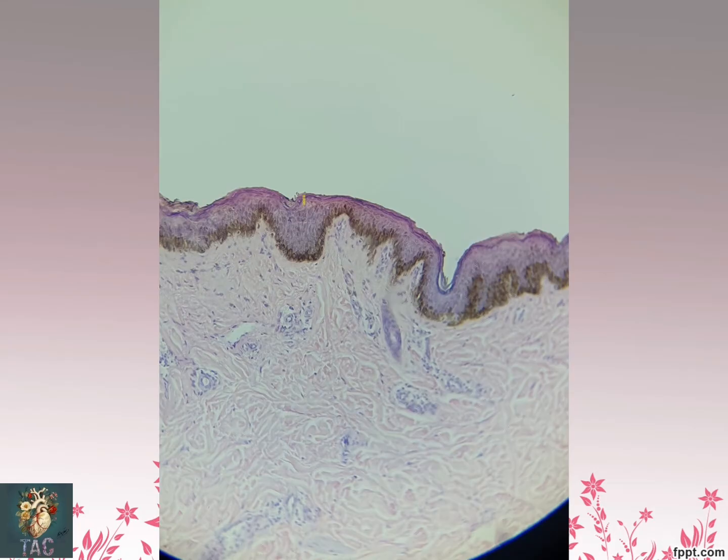Here you can see this is the thickness which shows you that the epithelium is basically stratified. So look at the surface cells. These cells are squamous in shape. Also you can see the keratin which is present over here in these areas. Also you can see the hair follicles which are present. This is the section of the smooth muscle cells, the erector pili, over here. This is the section of the duct of the sweat gland, and this whole is the dense irregular connective tissue which is forming the dermis. So this is again another slide for the thin skin.